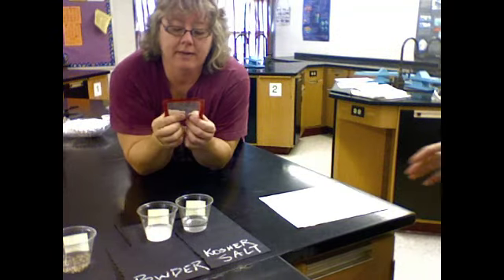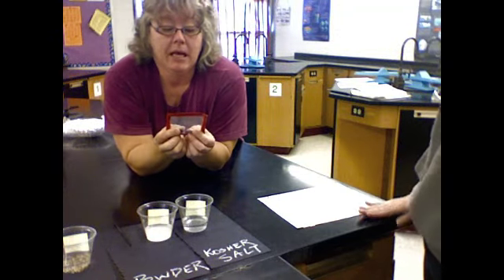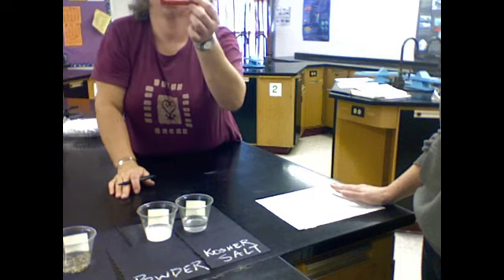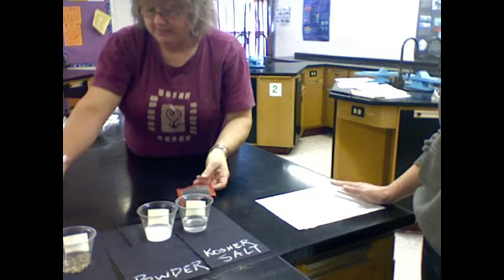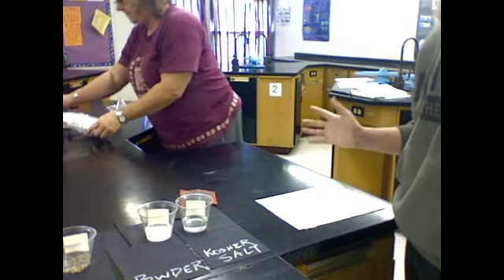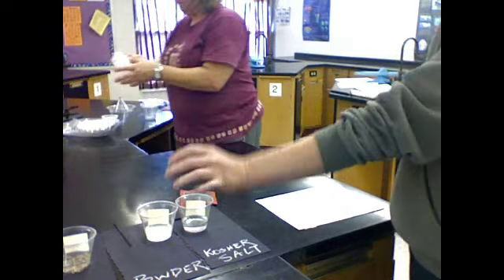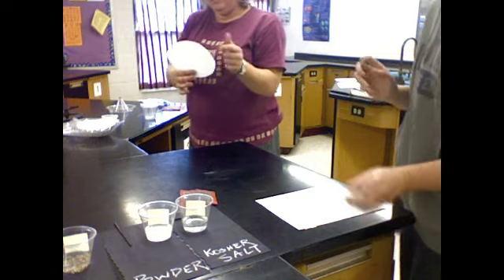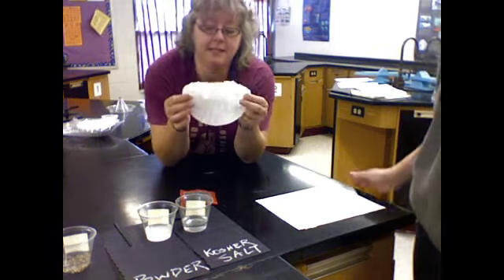And if I were going to describe this screen, it's made of metal. Can I see that pen, Miss Stilson? The holes in this are big enough that they're about the size of the tip of this pen. So they're big enough for me to see them. Like a screen door. You can certainly see through it, but it won't let the bugs into your house. Always important.